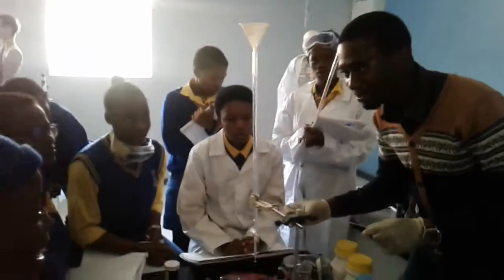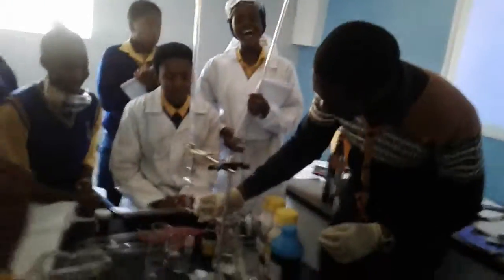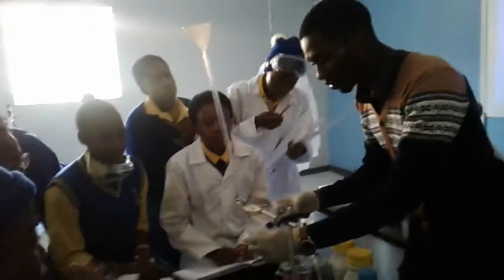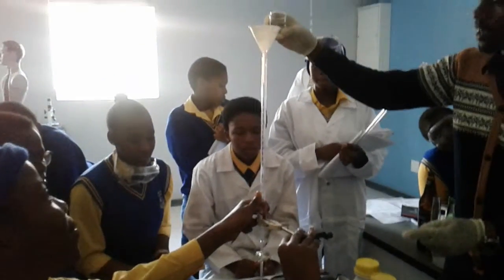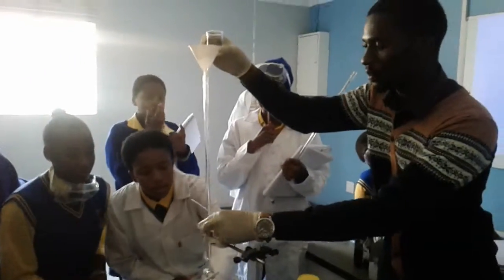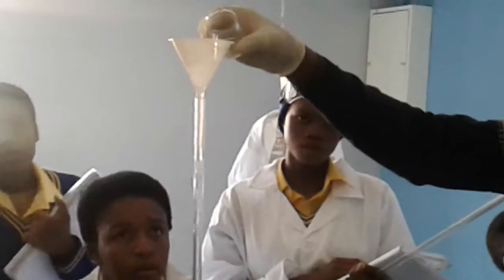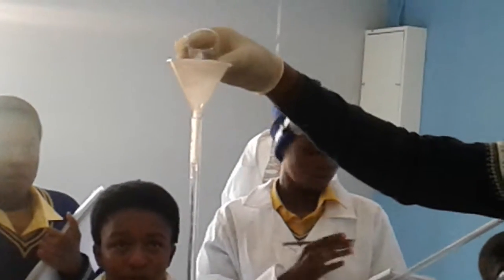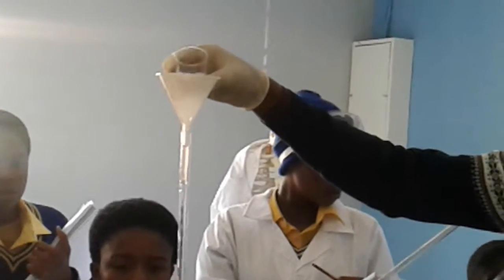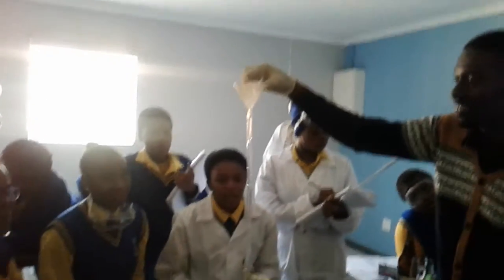Guys, you must remember we are live. So let's talk properly. Alright. So what am I doing? I'm adding this. I didn't close. Can you just hold it? Okay. Guys, please be careful. This is oxalic acid. Be careful when you're adding the oxalic acid. Guys, don't worry, oxalic acid is a weak acid, so it's not so dangerous. But it's still dangerous.